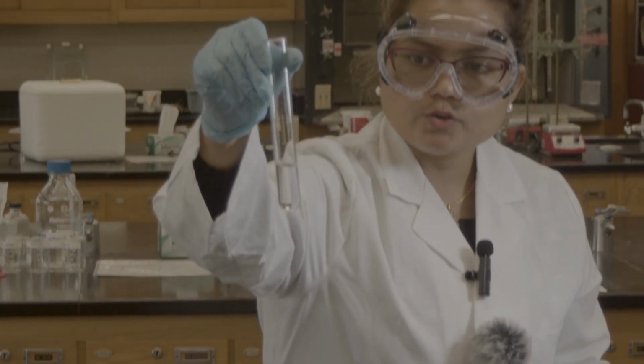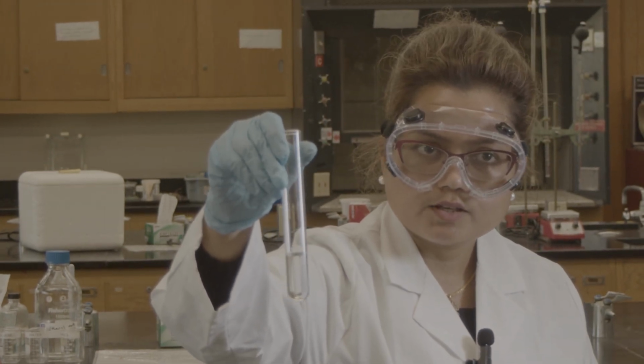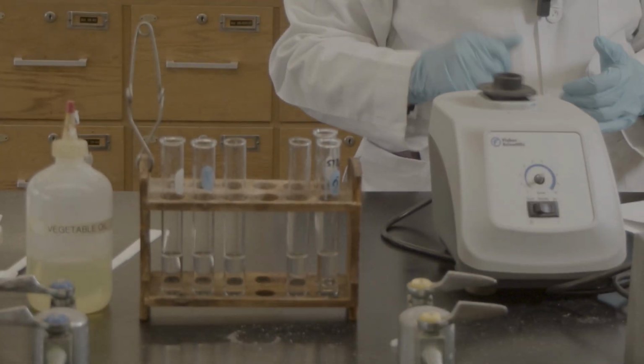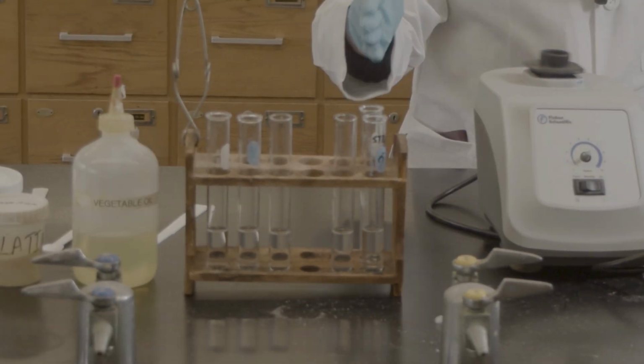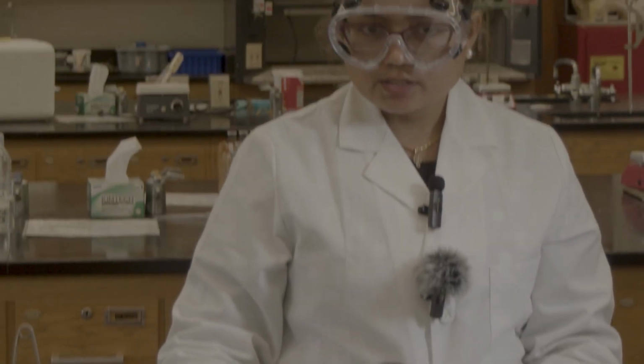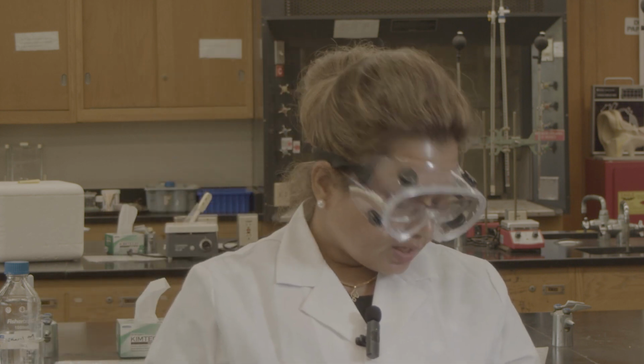You can see there is no solid in here. So sucrose interacts with the polar molecule of hydrogen and oxygen. So it dissolves in the water. It is not an ionic compound actually, so it dissolves.